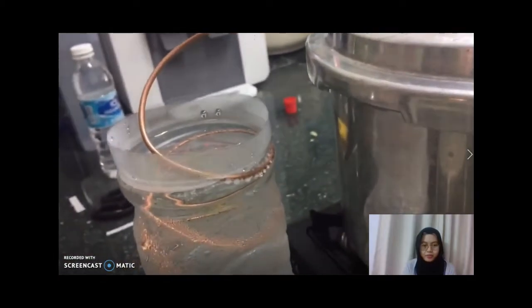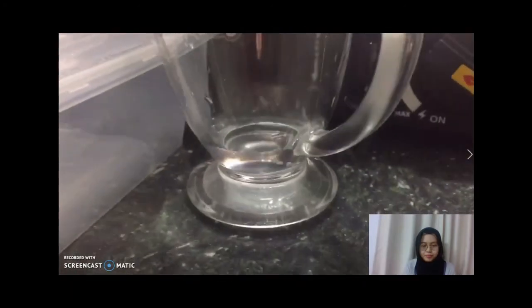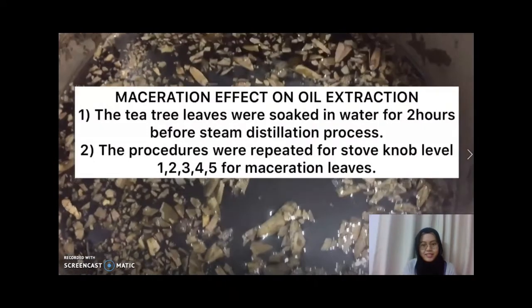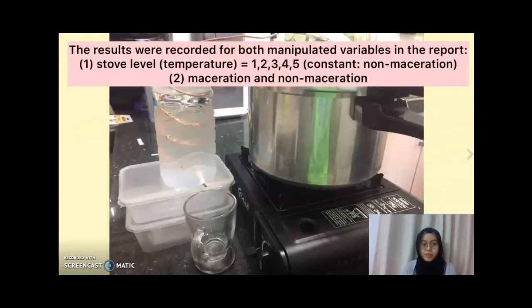And the copper tube is hot. So this is our tea tree leaf oil. And the next factor is the maceration effect on oil extraction. The results will be recorded for both manipulated variables in the report.